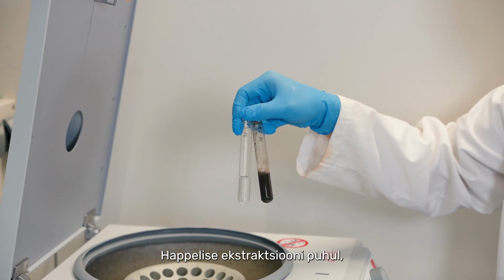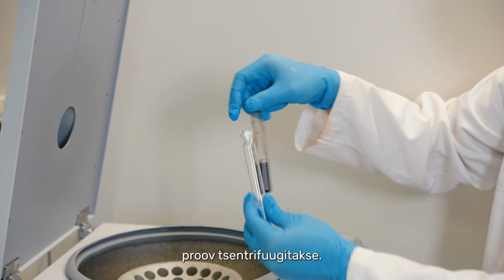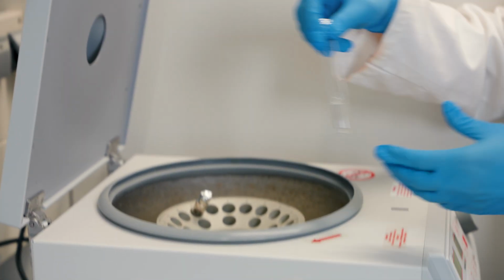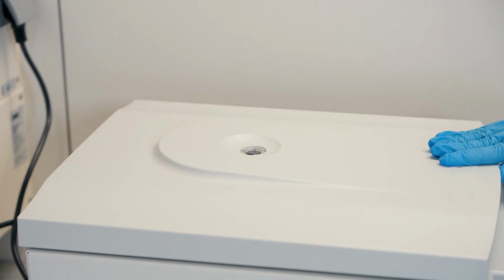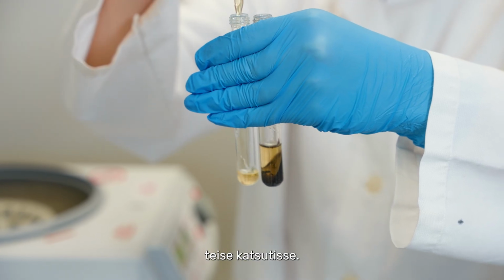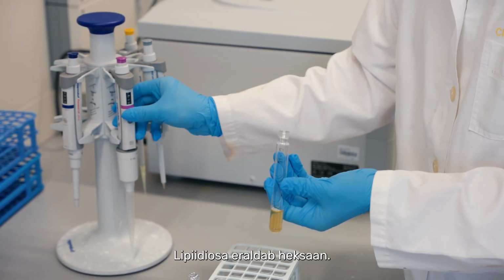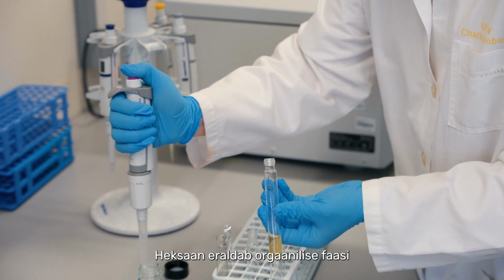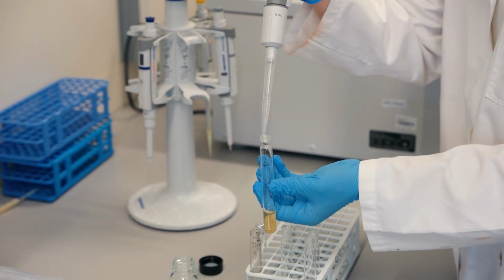For acid extraction, after heating and hydrolyzing, the sample will be centrifuged. After centrifuge, we will transfer the liquid part to another tube. The liquid part will be separated by the hexane. The hexane will extract the organic phase and then separate the aqueous phase.